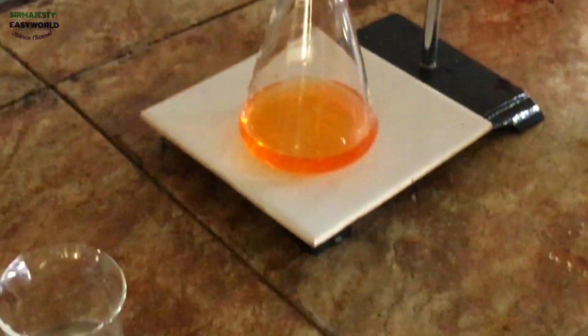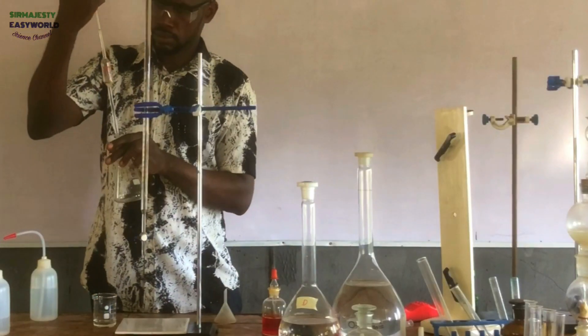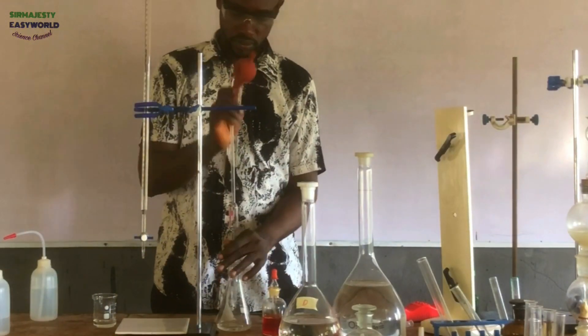22.80 — it is not very far. It is still concordant. It's not very far from the rough. Then we do the second titration and see what it will give us.